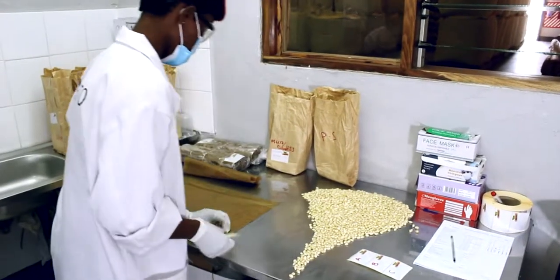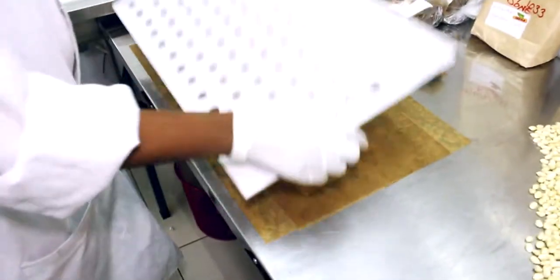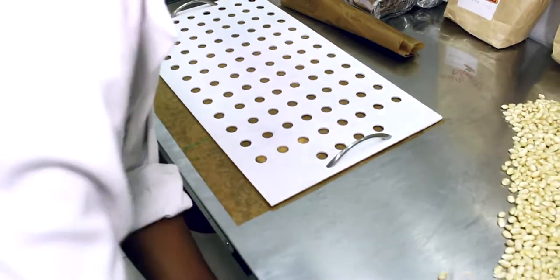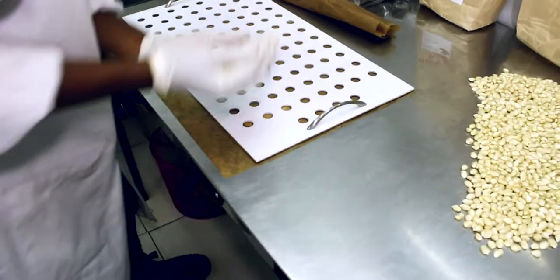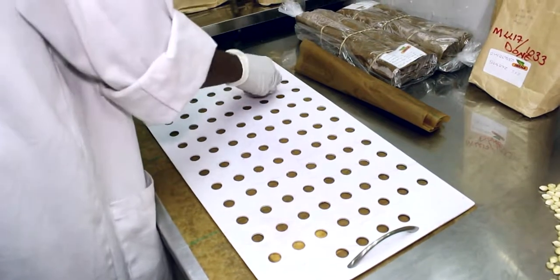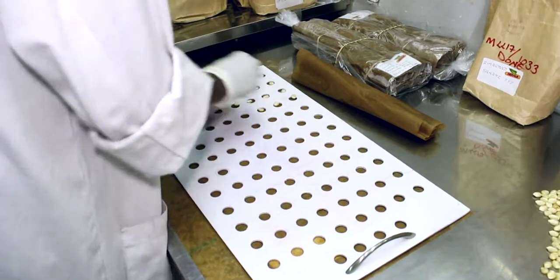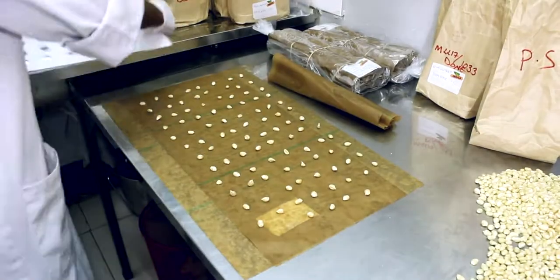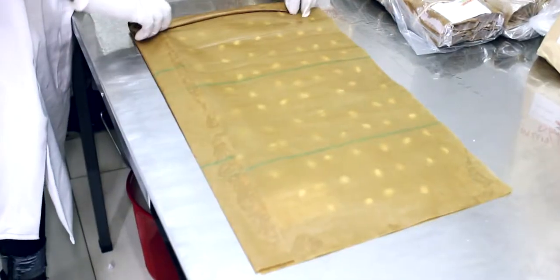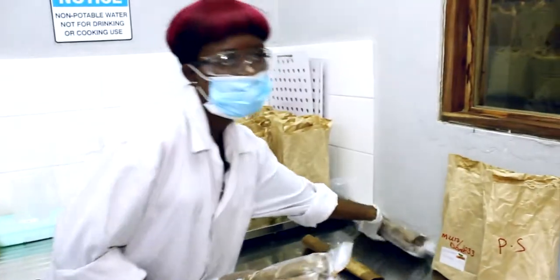So we do germination on paper, and this is pre-soaked paper, which we soak overnight in measured quantities of paper against the water. So we plant 4 replicates of 100 seeds each per sample of seed received in the lab. This is how we prepare.